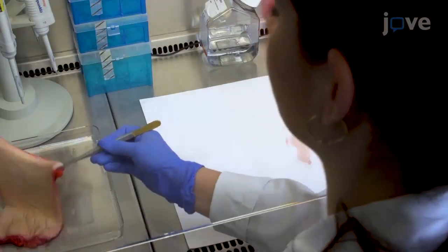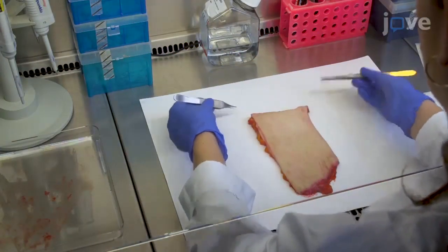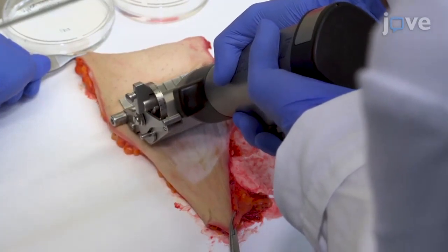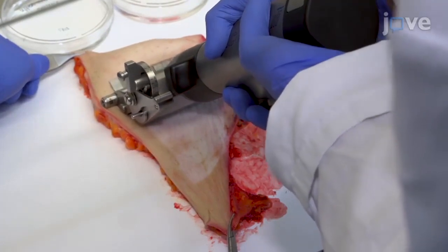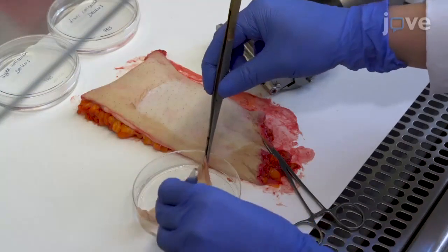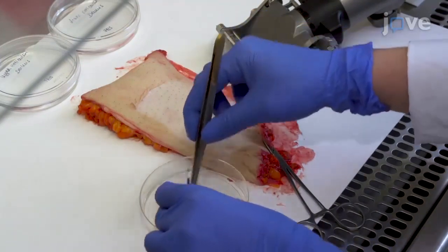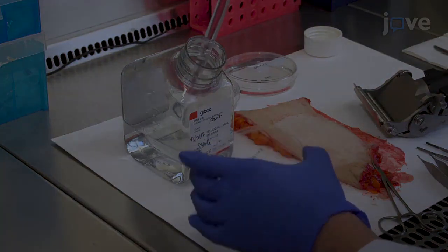To section the dermis into papillary and reticular layers, place a piece of skin on a thick filter paper with the epidermis facing upwards. Hold the skin tightly on its edges with forceps and slice out a section of 300 µm thickness with an electric dermatome. Transfer the first layer consisting of epidermis and papillary dermis to a petri dish. Then proceed immediately to separate the epidermis and dermis, or add 1x PBS to keep the tissue from drying out.